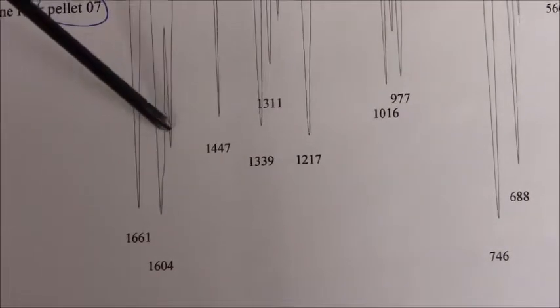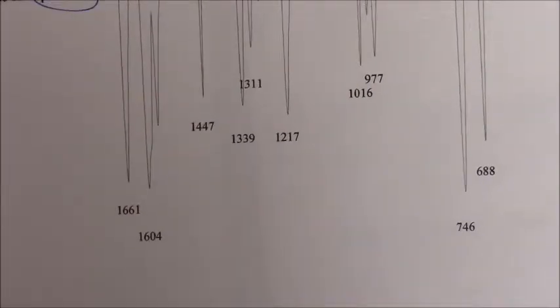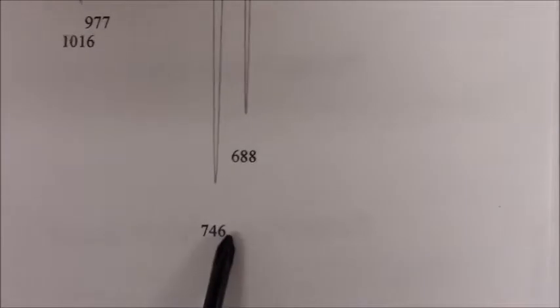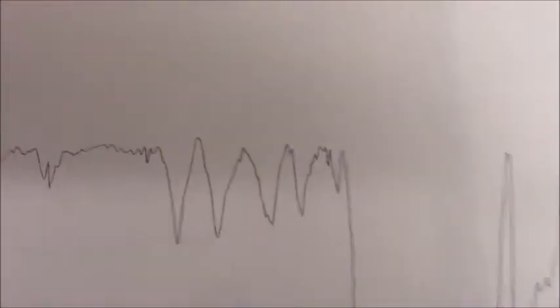And then as usual, the benzene ring, you can see one right here, along with this one. Aromatic carbon-carbon double bond stretch. I don't really see much else in this region that's very diagnostic. This one, however, stands out as the mono-substituted out-of-plane bend aromatic stretch. And again, this is the characteristic mono, the classic 4 peaks on a slight angle down. That is the overtones of the mono-substituted benzene ring. So that takes care of that one.